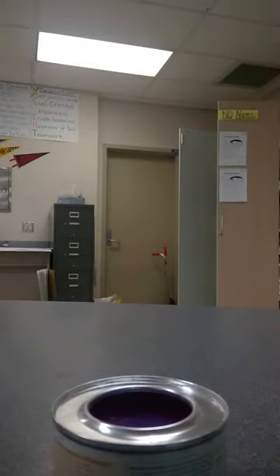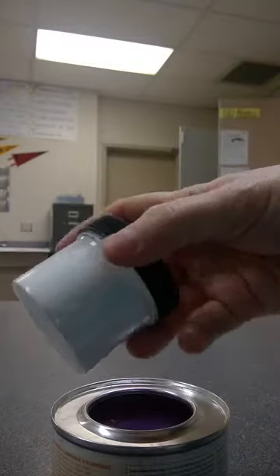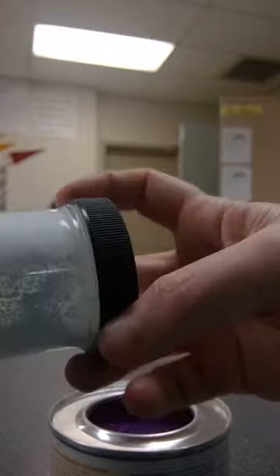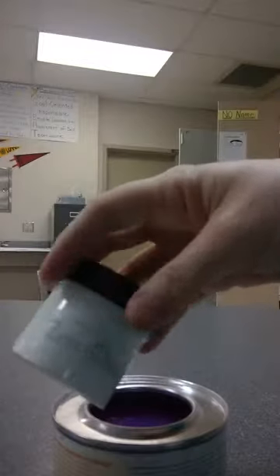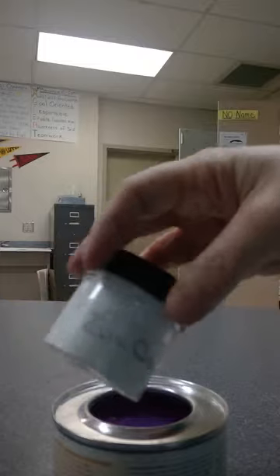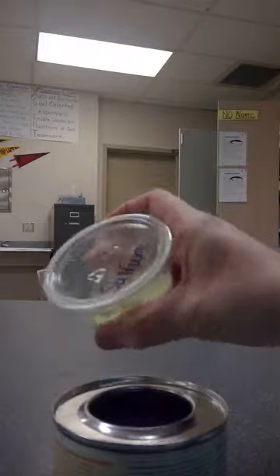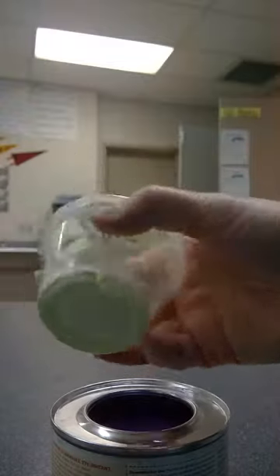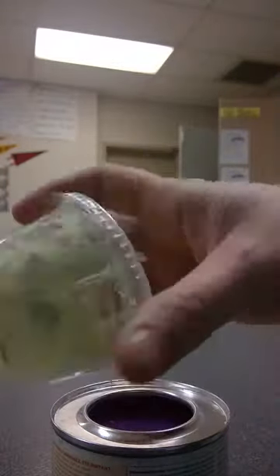Then we have zinc oxide, which is also a white solid and very powdery. Our last substance is sulfur — sulfur is a solid, bright yellow in color, and quite powdery.